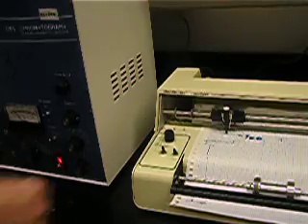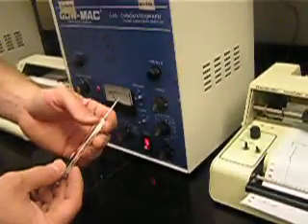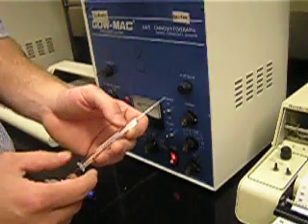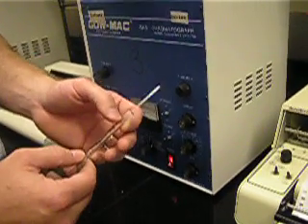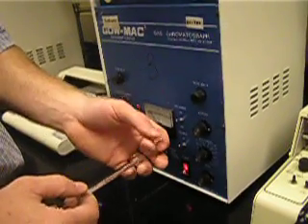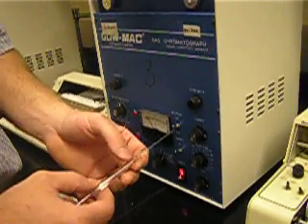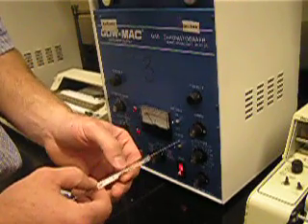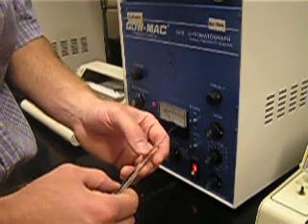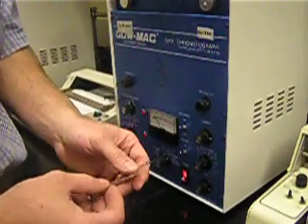You can check by just toggling the zero knob. If you see movement of the needle, you're ready to go. When drawing up your sample, be very careful. If you have a small glass syringe, sometimes you can miss the liquid. You need to make sure when you draw that you actually see the meniscus of the liquid inside the chamber and not just air. Sometimes the tips are clogged and you won't draw liquid. Draw the liquid such that there's always a little bit of air between the liquid and the plunger. Watch the meniscus and bring it up to, say, five microliters — you'll need to move the plunger beyond five so that you have five microliters of liquid.